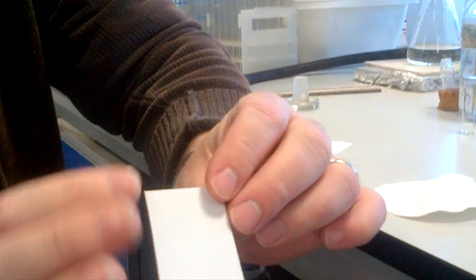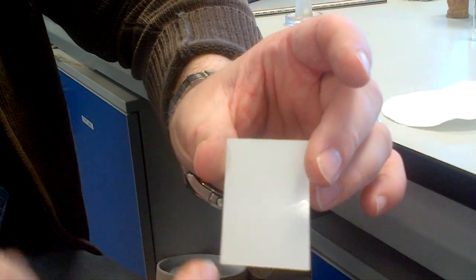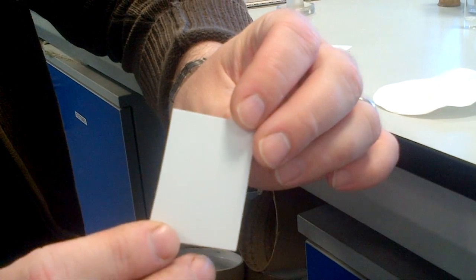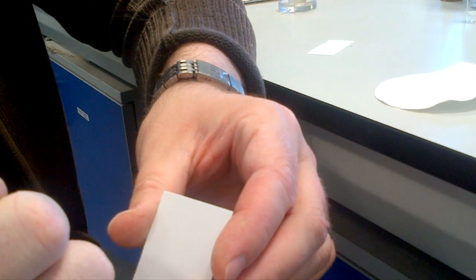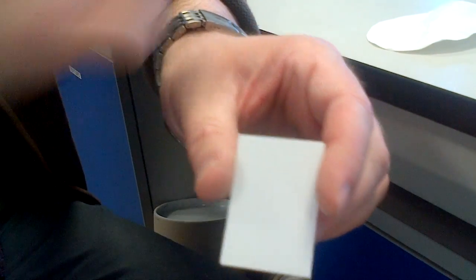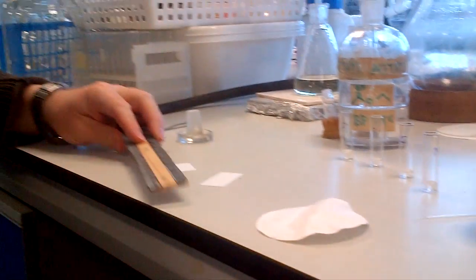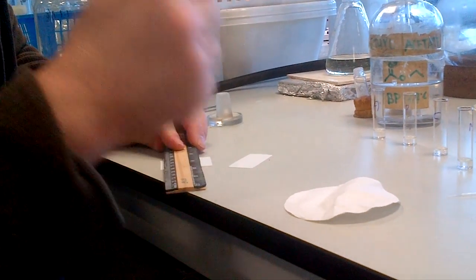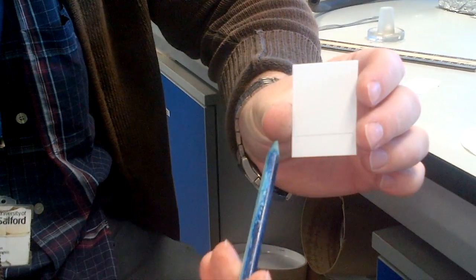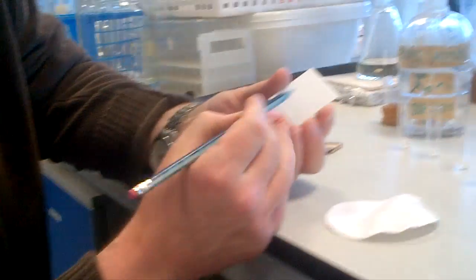You'll need to take the TLC card — these are silica-fronted cards with a rough surface at the front and a plastic back. Mark on the rough silica surface; don't spot samples on the plastic back. Using a pencil — not a pen, because pen ink can dissolve in the organic solvent — take a ruler and mark a line about half a centimetre from the bottom. Don't press so hard that you scratch the silica off the TLC plate.